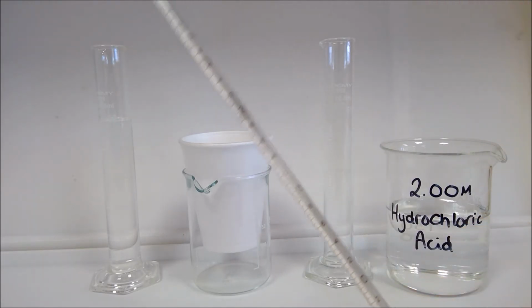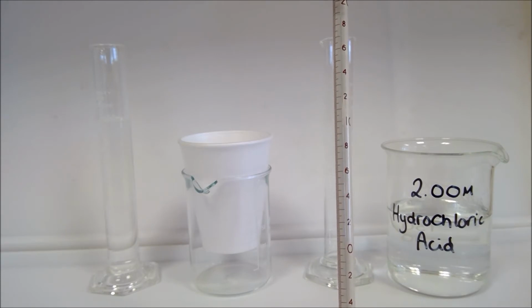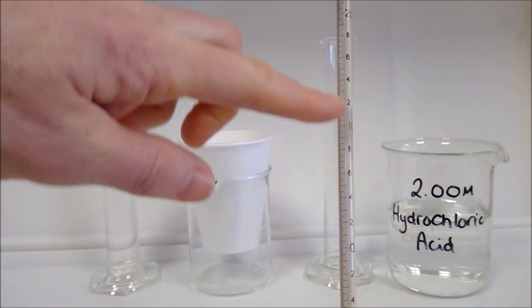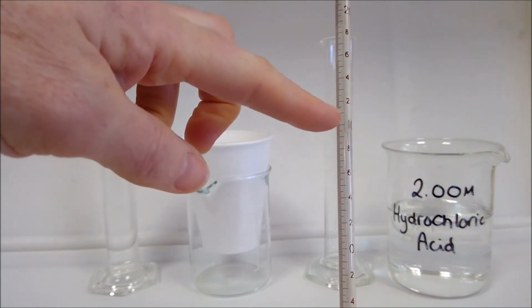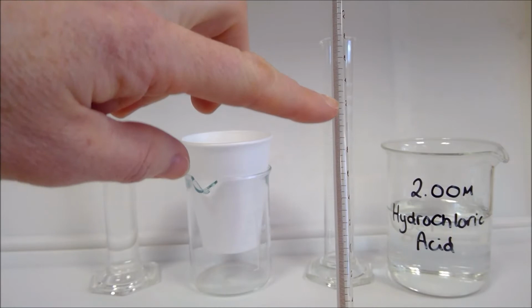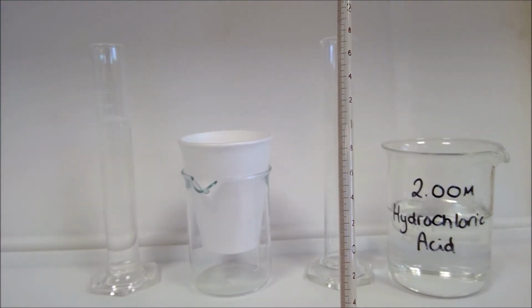Later on, when you're doing your questions, you need to consider the percentage uncertainty in each of the temperature rises. So if we just have a look at the thermometer I'm using here, I think that's sufficiently focused, we can see that our big increments there are 2 degrees apart. So here, then we've got our kind of medium one, 1 degree, and then if you have a look, we've actually got tiny increments here going up in 0.1 degree intervals.